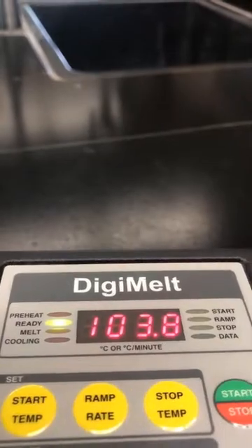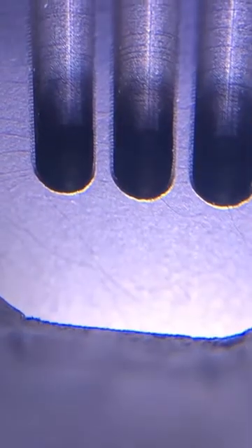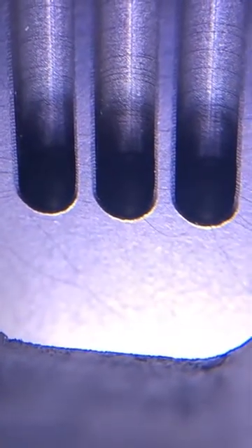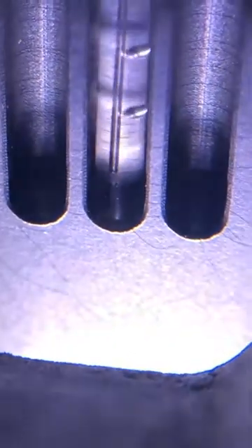Yeah, so we're just about ready to start. It says it's ready. It'll get to 105. That's where it's going to start to. So I wanted to zoom in and show you what this looks like. When I put the capillary in, and I'm going to stick it in the middle one, you'll notice bubbles right away.